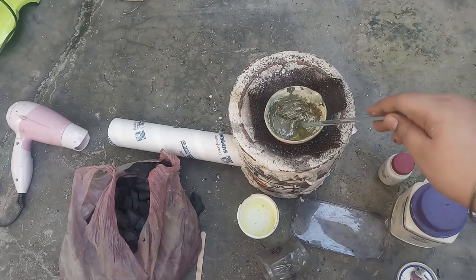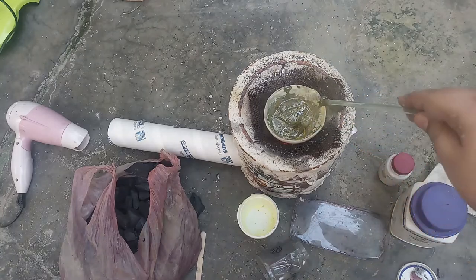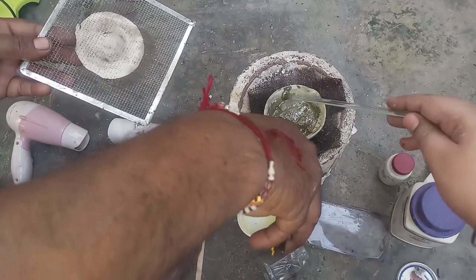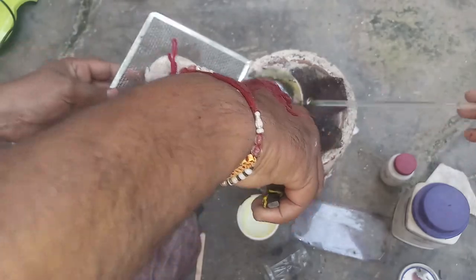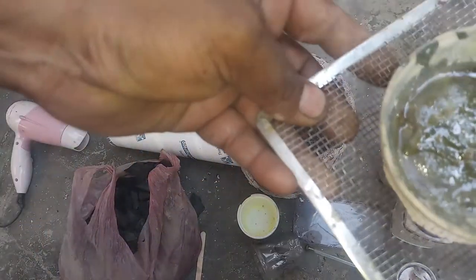Now time to take it off. Do this under adult supervision. After this reaction, we have to close this now.